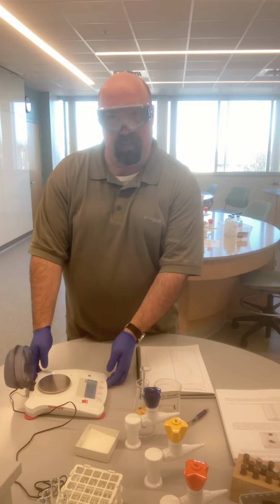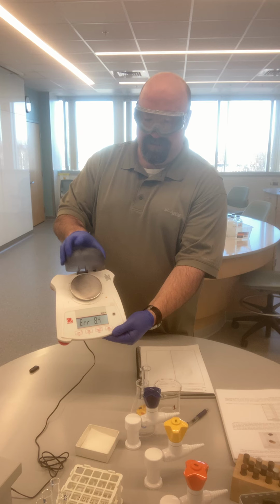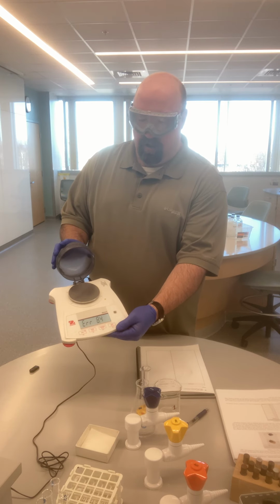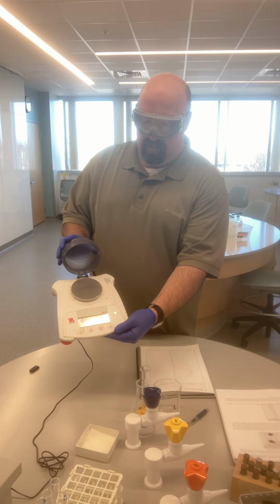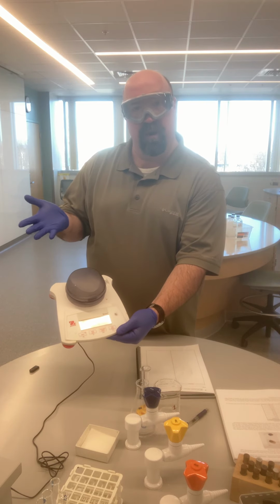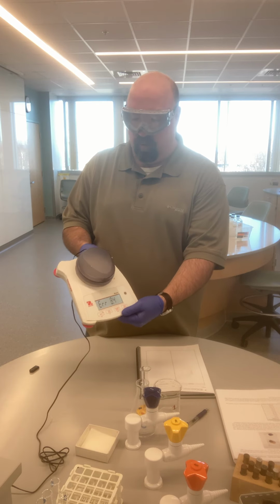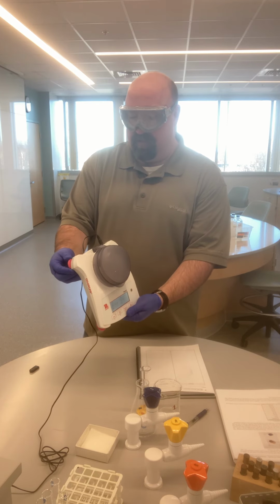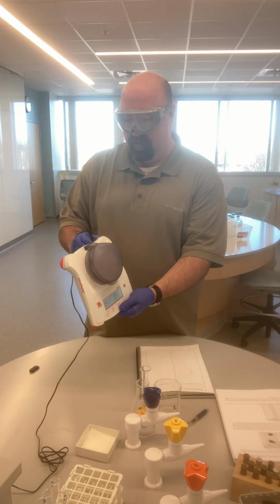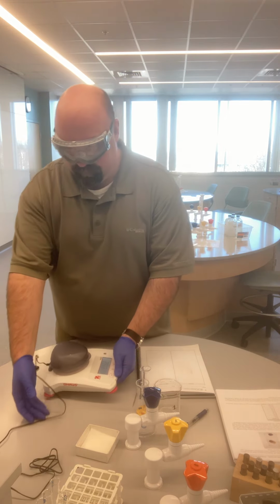And so this is what a typical balance would look like. So you can see it here, a lid. If the item that we're taking the mass of is small enough, then we're able to close the lid right over it. It gives us more accurate measurements, because many balances are sensitive enough that even airflow moving over it can affect the measurement. So we always want to try to close our lid whenever we can. The balances have adjustable feet on their bases so that we can always make sure that they're level as well.